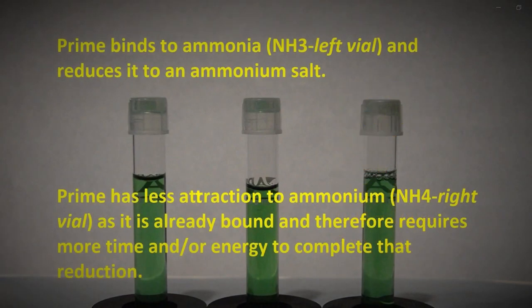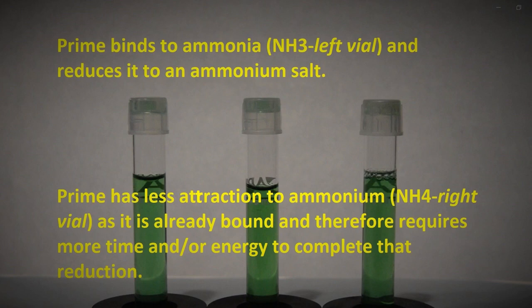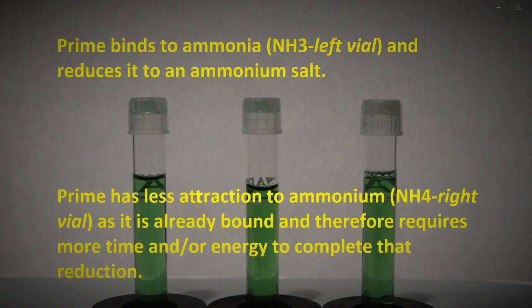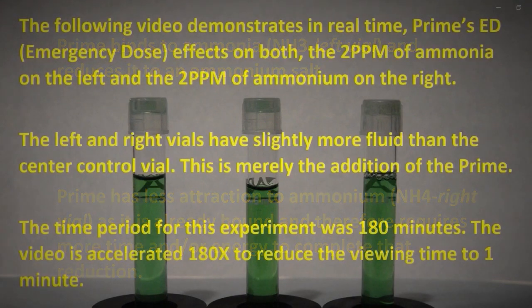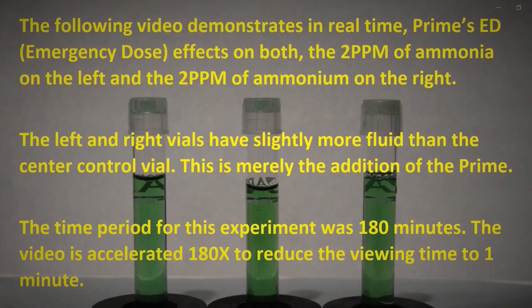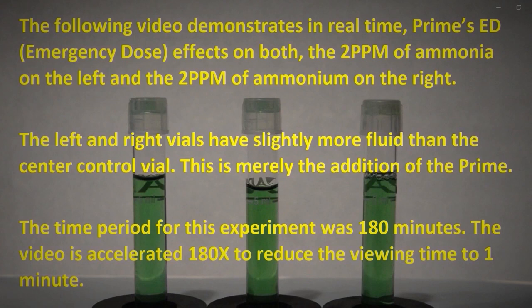Prime binds to ammonia and reduces it to an ammonium salt. Prime has less attraction to ammonium, as seen in the right vial, as it is already bound and therefore requires more time and or energy to complete that reduction. The following video demonstrates in real time Prime's effects on both the 2 PPM of ammonia on the left and the 2 PPM of ammonium on the right.